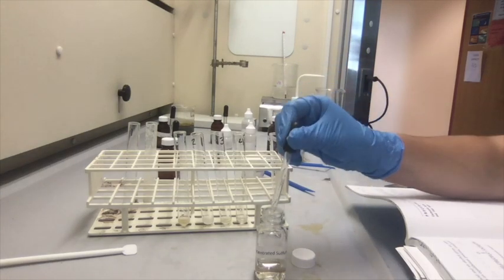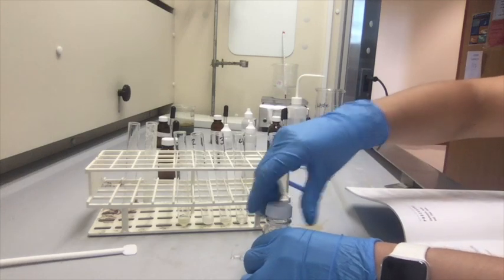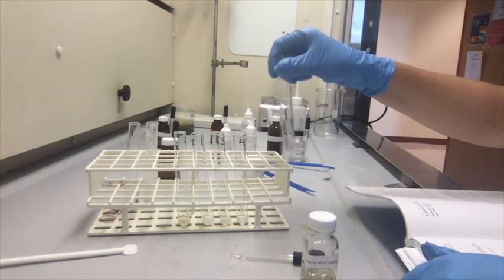Just like that. And then we're going to mix them. I just kind of go like this.